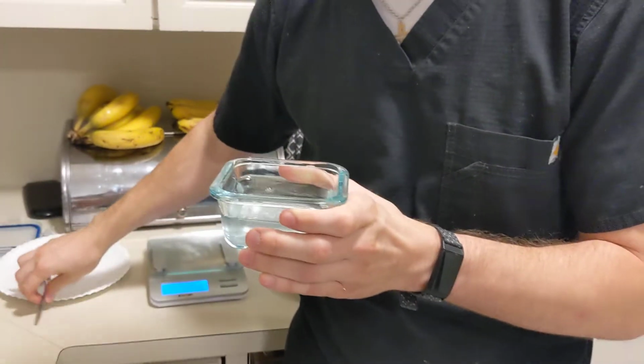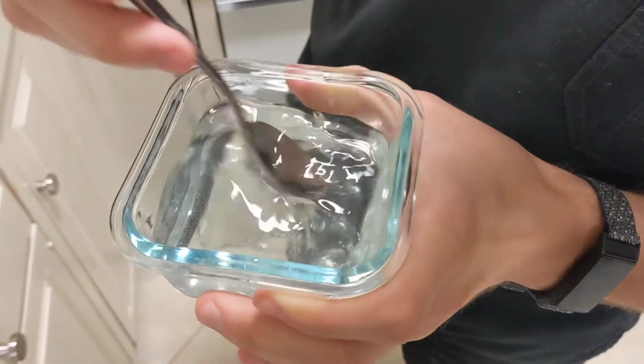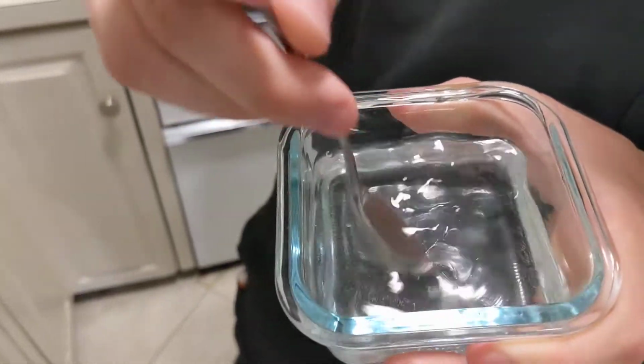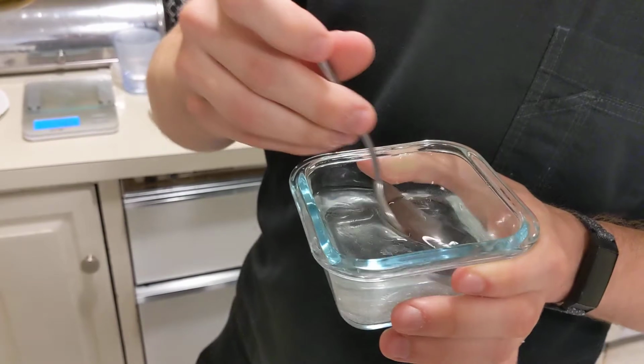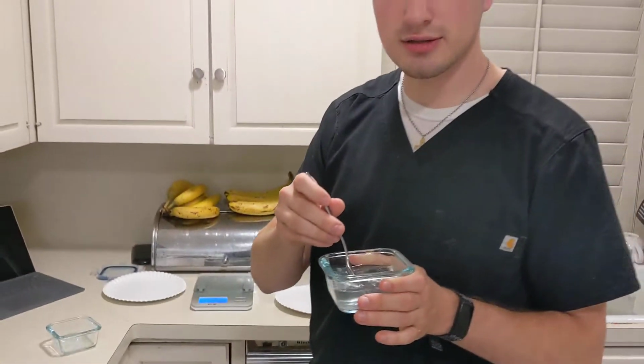I think this should do it. So up to this point, the solution has been saturated, as not all of the salt that I've been adding has been dissolving, either because of the potassium iodide and the other salt that's dissolved in it has been too much for the water's capacity to dissolve.